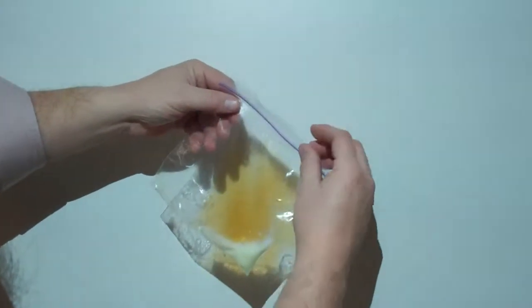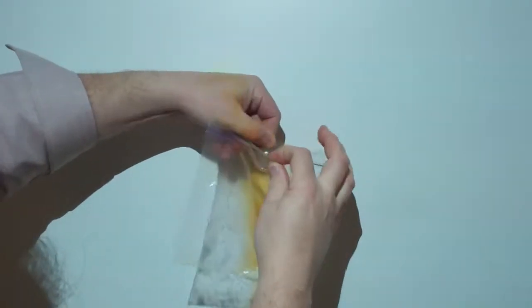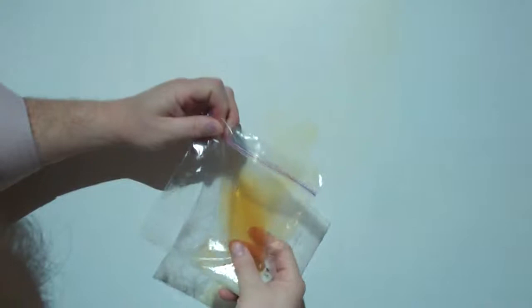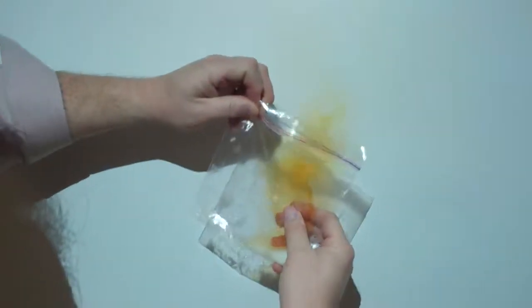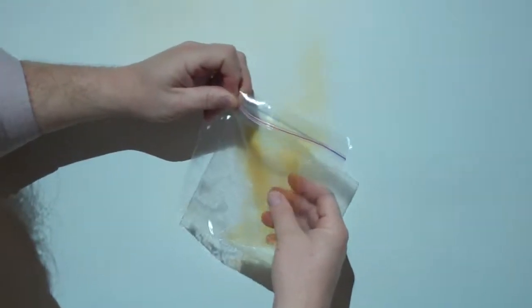And let's check to see what this gas looks like and smells like, and as we release the gas, you can see puffs of the smoke coming out. And the smell is like chlorine, similar to a pool smell.